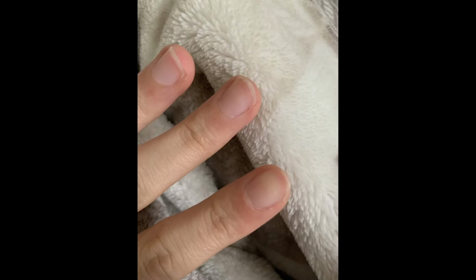Taking a closer look at these microscopy images, we start to identify grooves and small circular openings that reveal the same pattern as a finger. You can also see microscopic specks of dirt and dust not visible to the human eye alone. This image also specifically shows sweat produced by the sweat glands under the skin and perfusing from its pores. This is a microscopy image of the fingernail.